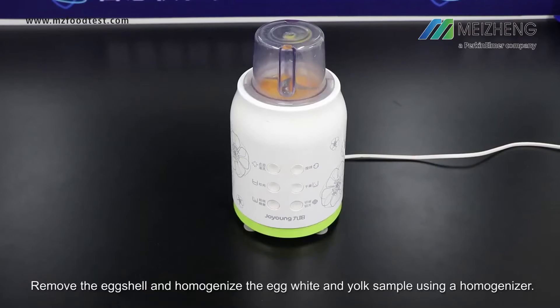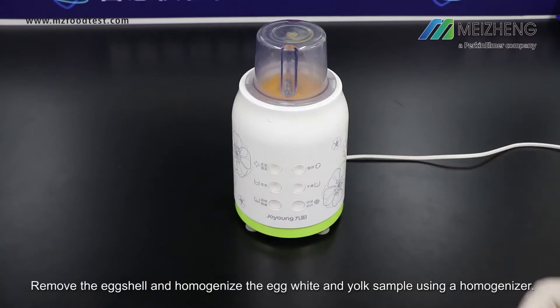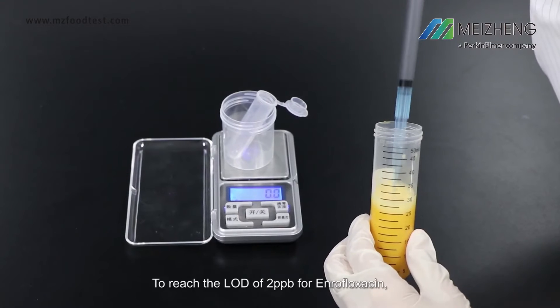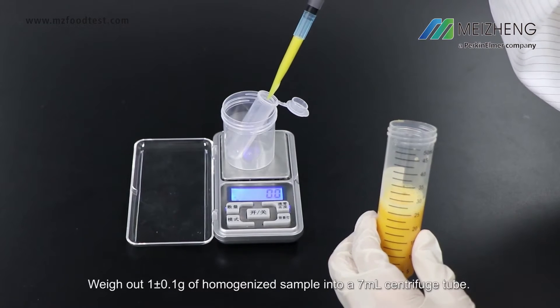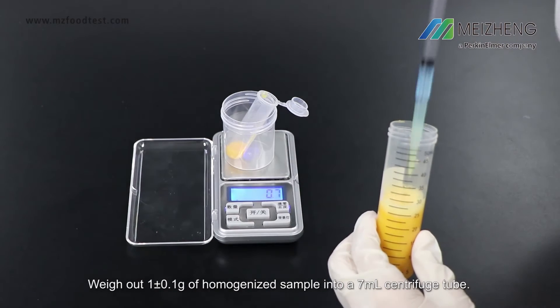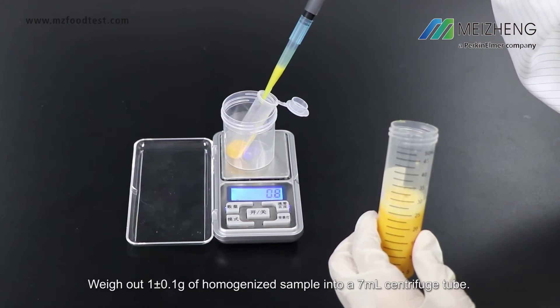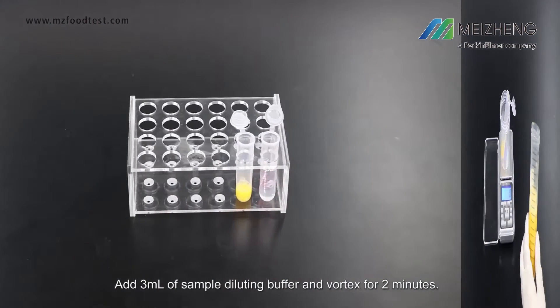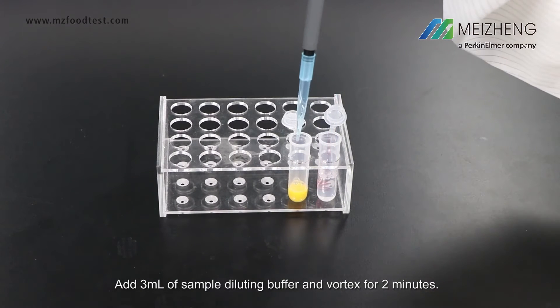Sample preparation. Remove the eggshell and homogenize the egg white and yolk sample using a homogenizer. To reach the detection limit of 2 parts per billion for enrofloxacin, weigh out 1 ± 0.1 grams of homogenized sample into a 7 ml centrifuge tube. Add 3 ml of sample diluting buffer and vortex for 2 minutes.